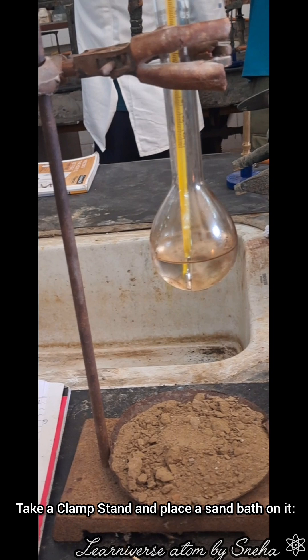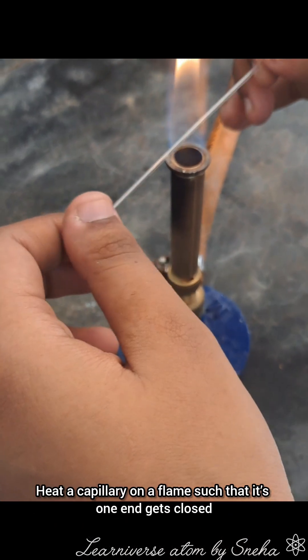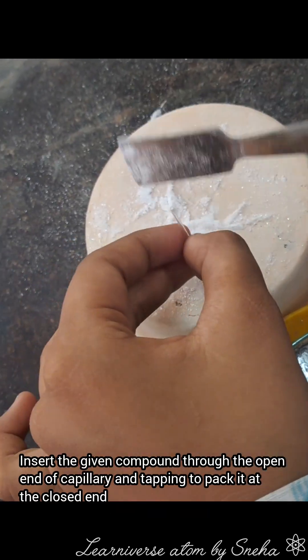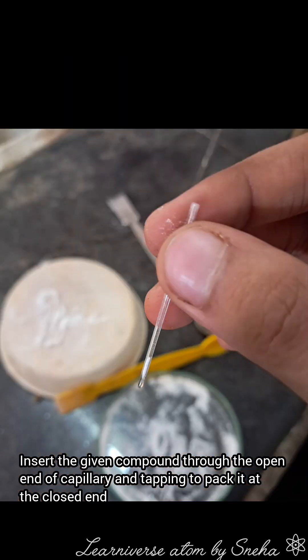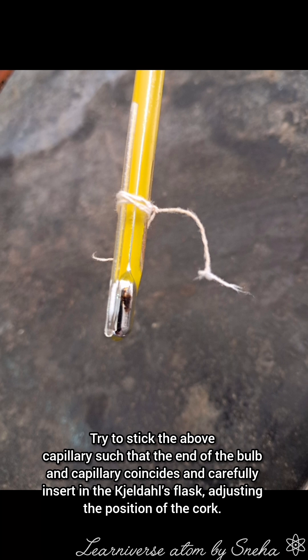Procedure: Take a clamp stand and place a sand bath on it. Clamp the Kjeldahl's flask with paraffin oil. Heat a capillary on a flame such that its one end gets closed. Insert the given compound through the open end of the capillary, and tapping to pack it at the closed end. Try to stick the above capillary such that the end of the bulb and capillary coincides.